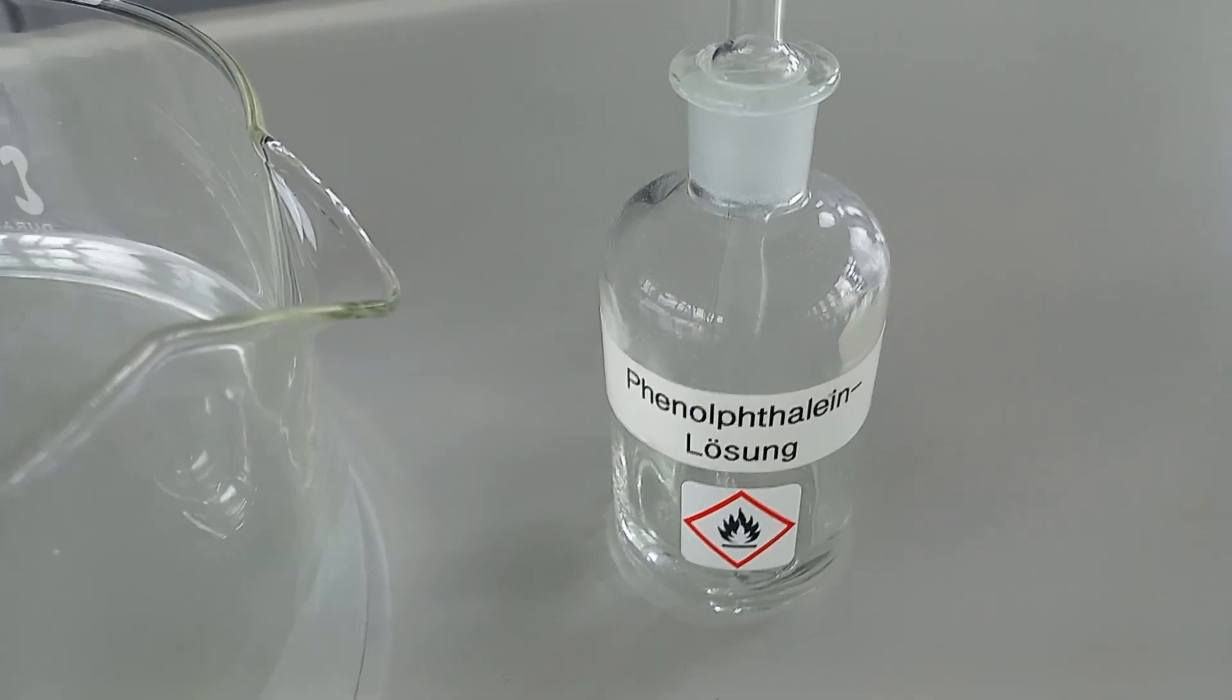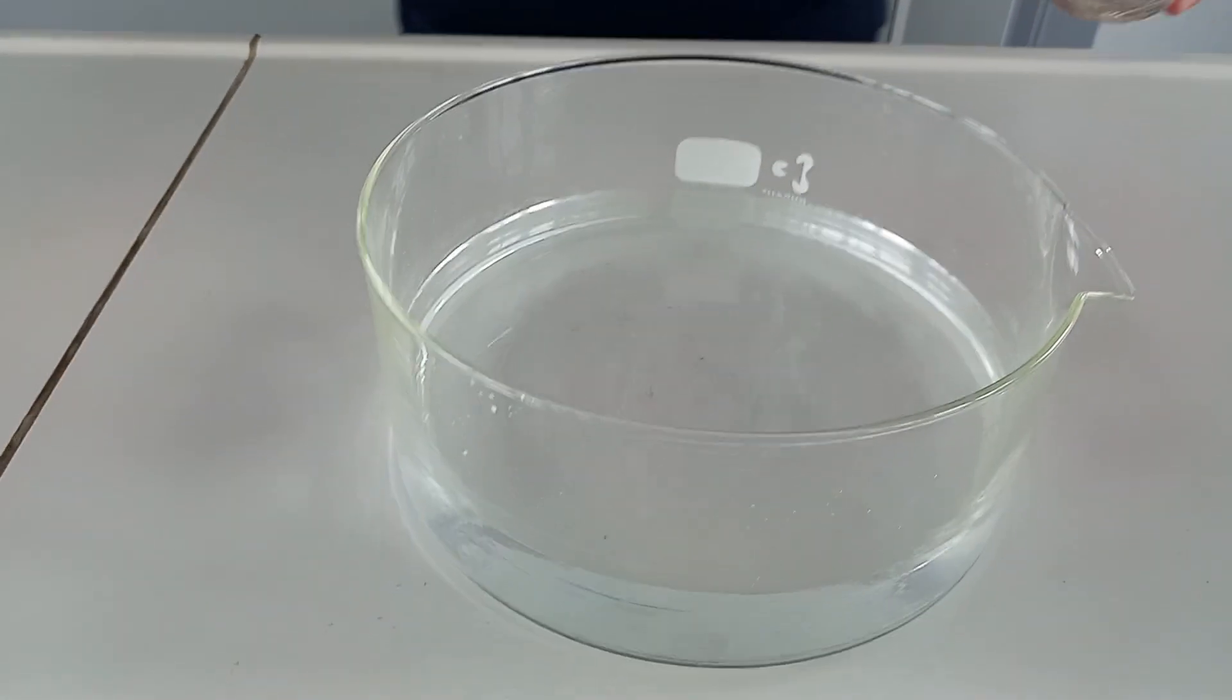Phenolphthalein is an indicator that turns pink when the pH rises above 10.